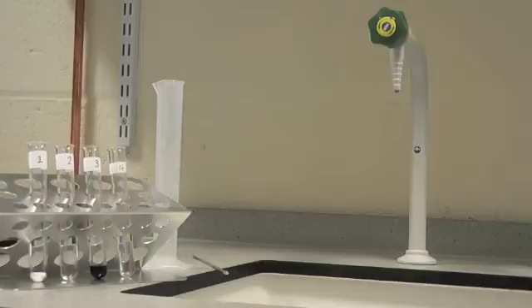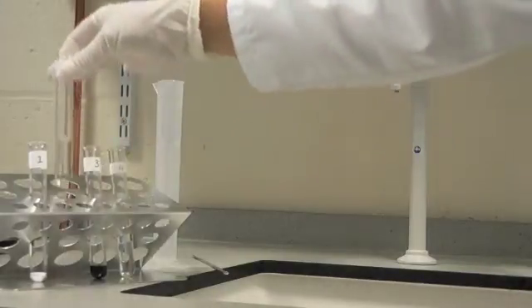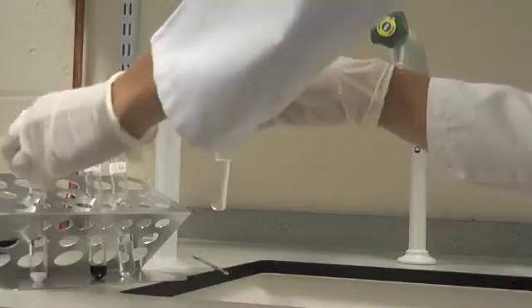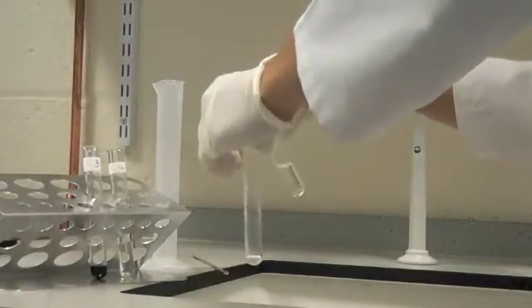Add the water, test tube two, to test tube one. Stir using a spatula.